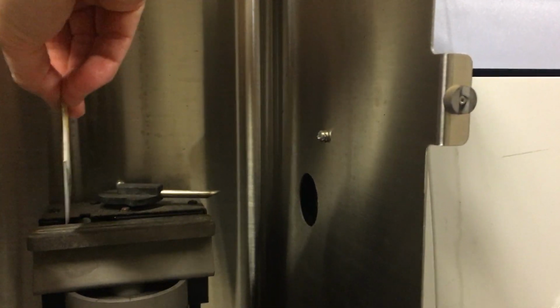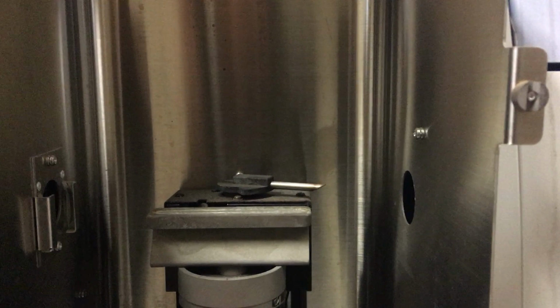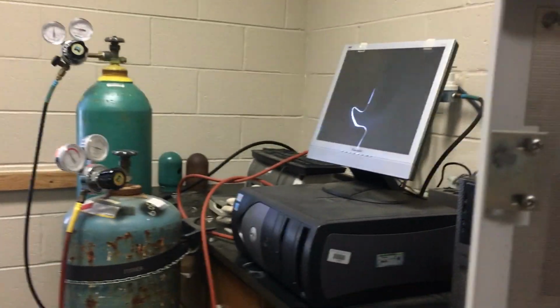Now that beam of light is directed out of the slit shown here and then across what is the burner head of the instrument. You can actually see that beam of light passing over the burner head and it will eventually exit over here. What's going to happen at the burner head is that there's a flame that is generated. Our flame is made up of acetylene and air coming from our tanks.